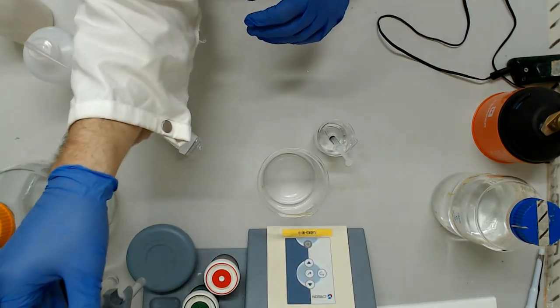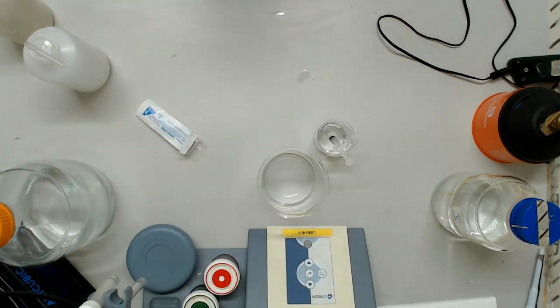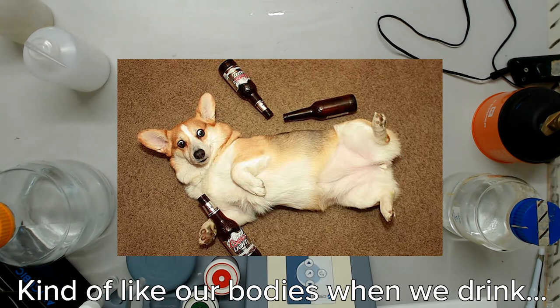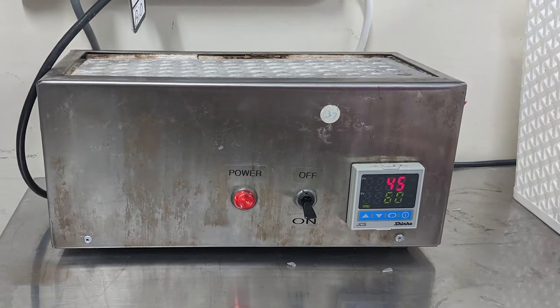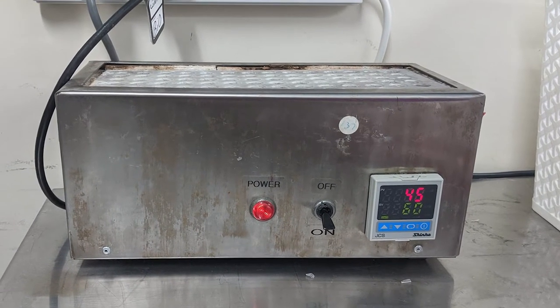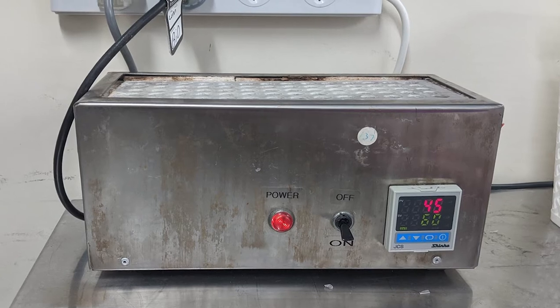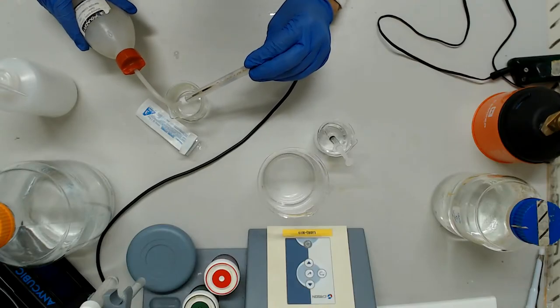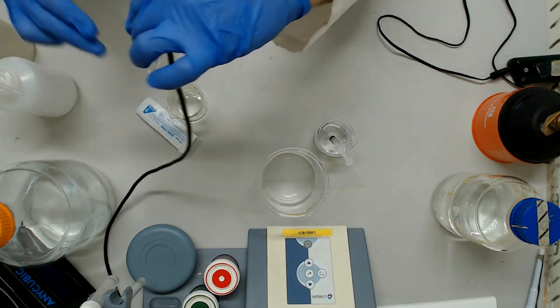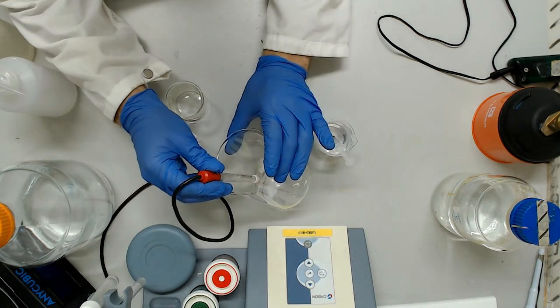Unfortunately, the presence of ethanol in your final DNA prep will have significantly negative effects if you plan on doing anything useful with it, from quantification to anything enzymatic. This is why an oven or heat block is one of the required pieces of equipment for mini prep, to evaporate residual ethanol from your centrifugation step. It's a great moment in the protocol for a coffee or lunch break. Just remember to wash your hands after handling all of these guanidine solutions.